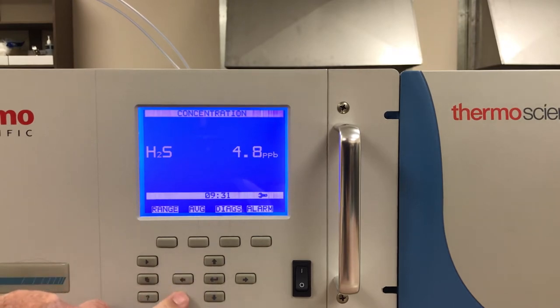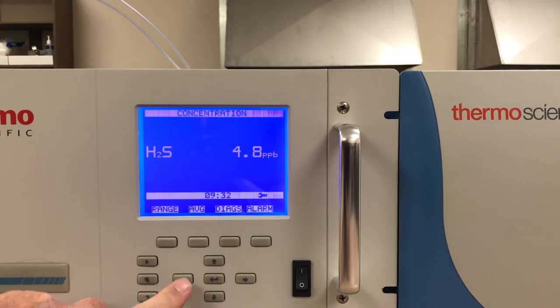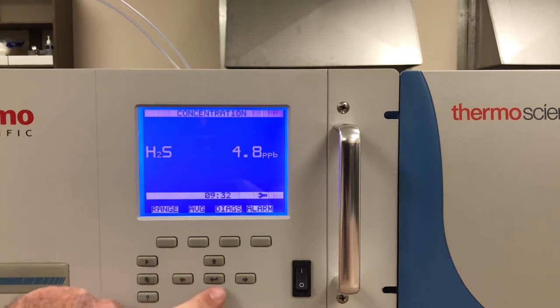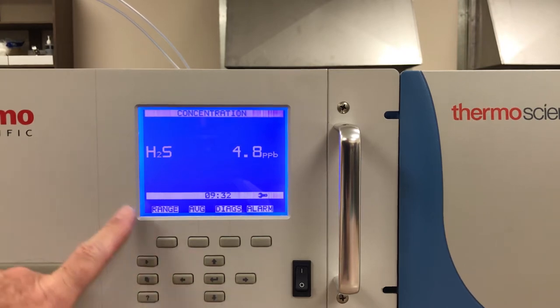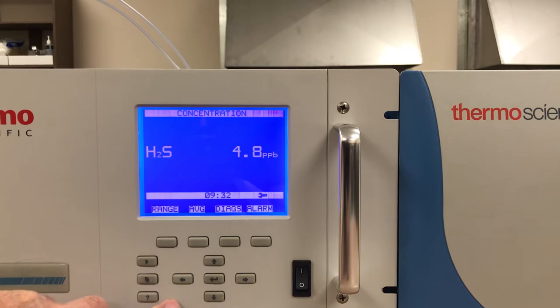One of the biggest differences between the i-series and the i-Q is that the i-series uses up/down arrows and menu buttons to access the menus in the software.